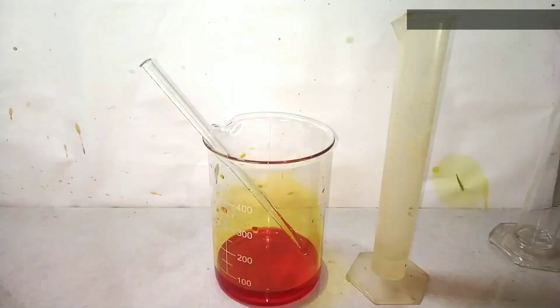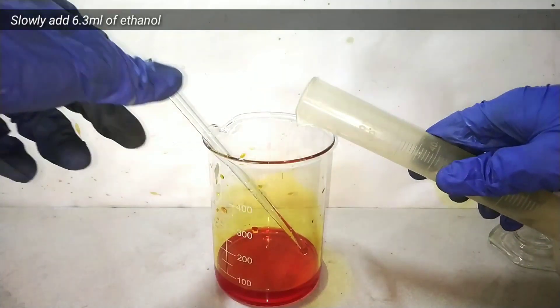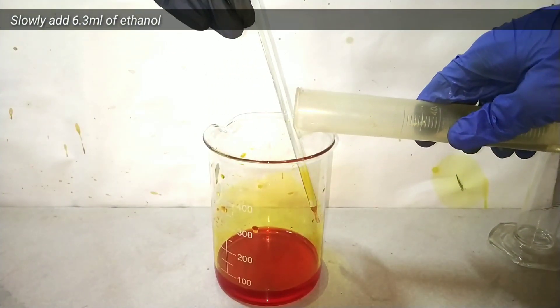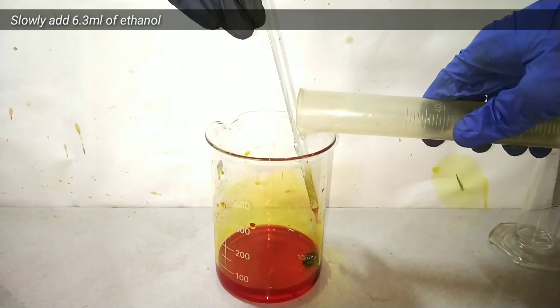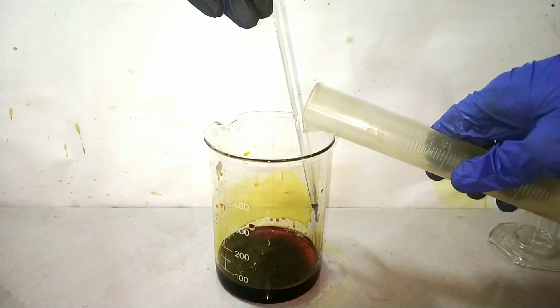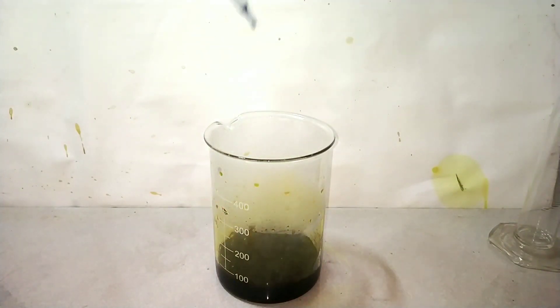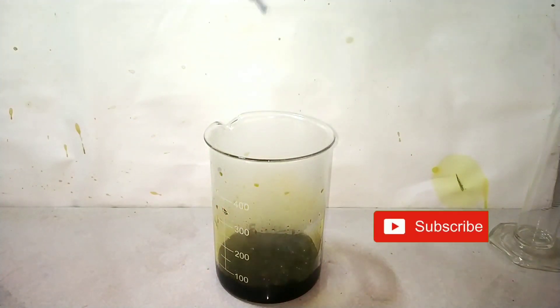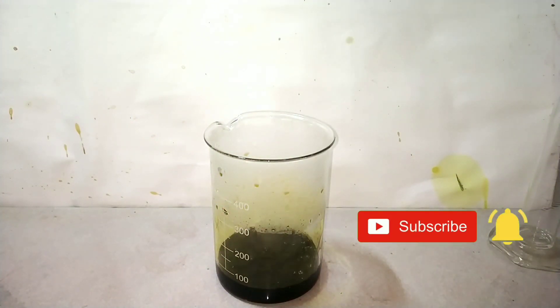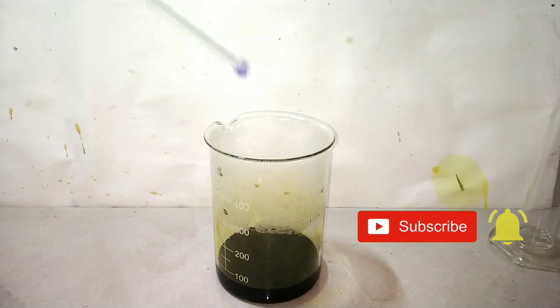Let the solution cool down to room temperature. The next step is the addition of 6.3 ml of ethyl alcohol, which should be added slowly in small lots. You can very well notice that there is a vigorous reaction taking place and it is extremely exothermic in nature.